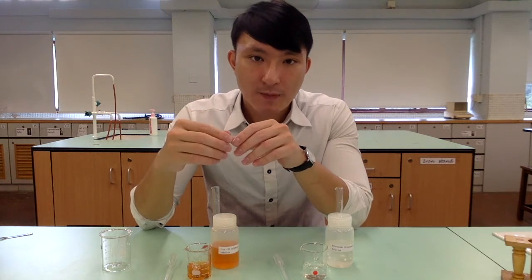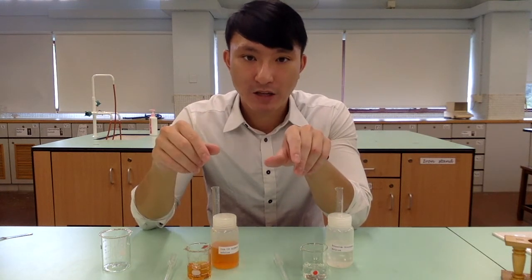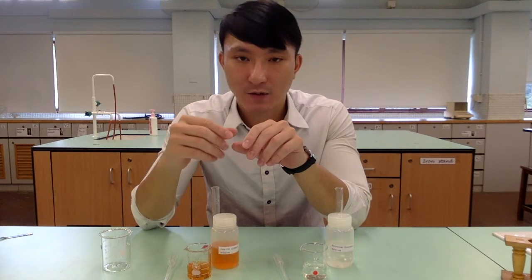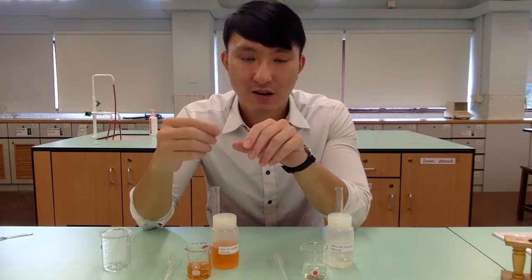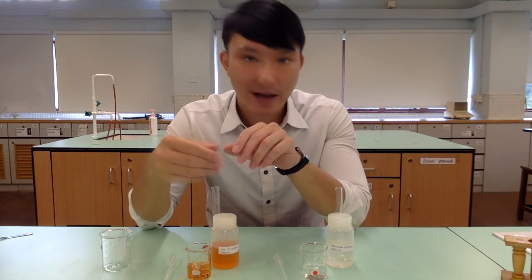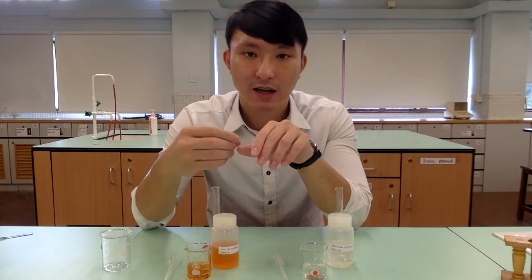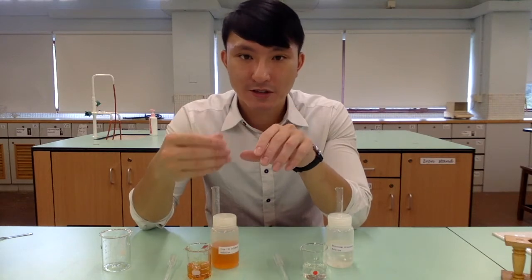In this experiment, we are trying to add different chemical reagents into the reaction mixture, aiming to change the concentration of one of the chemical species. We are interested in looking at how the changes in concentration of a particular chemical species affect the concentration of the complex ion product, and therefore how it affects the color of the mixture. So let's get started.